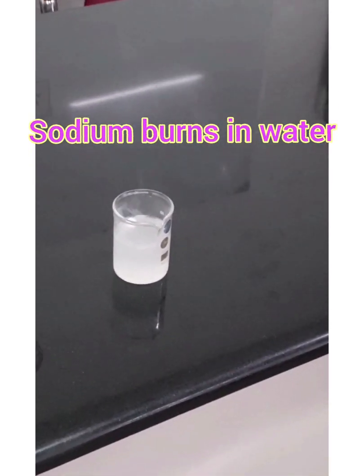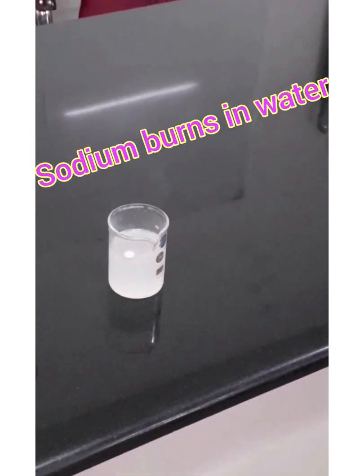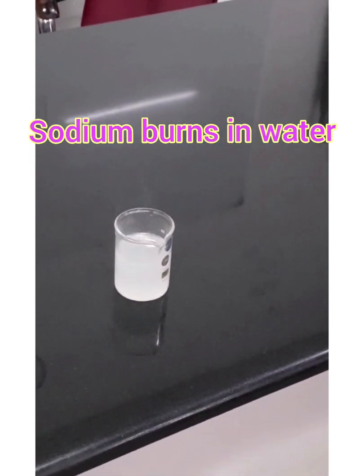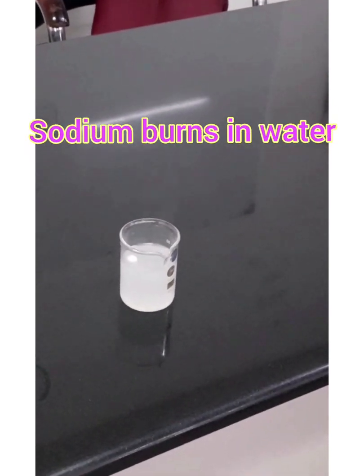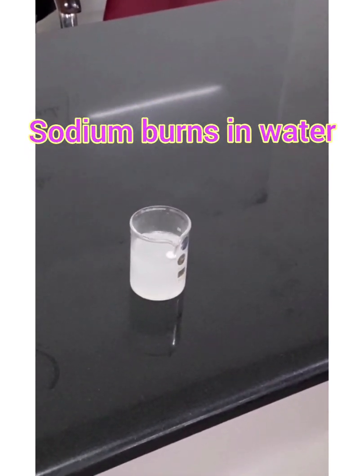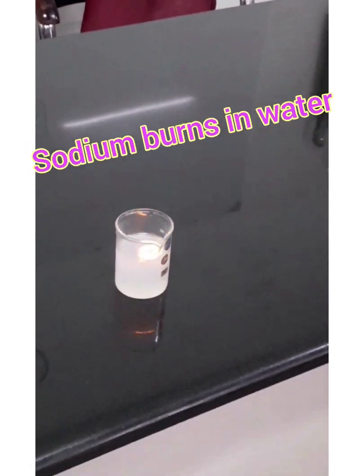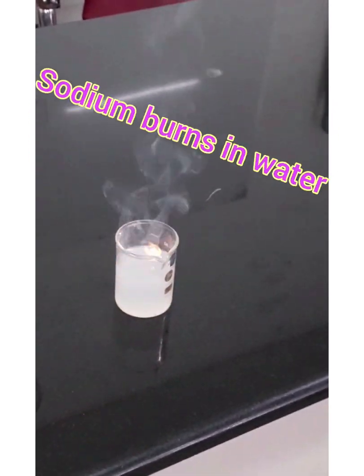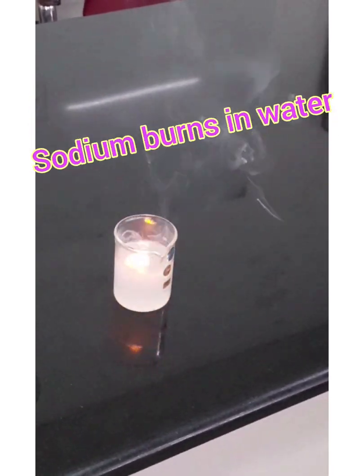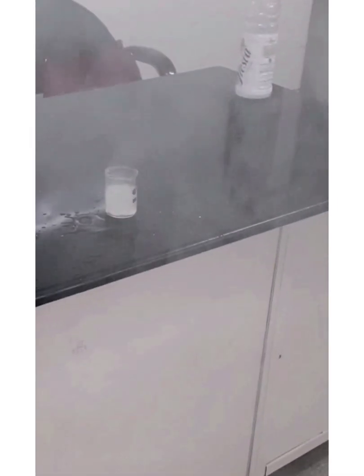Sodium is reacting with the water — that is why fire and smoke are produced. After this we will check the acidic and basic nature of the resulting solution with the help of litmus paper. What do you think it should be? Sodium is reacting with water.